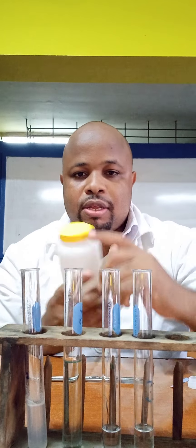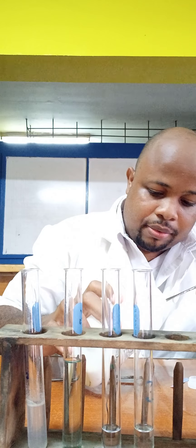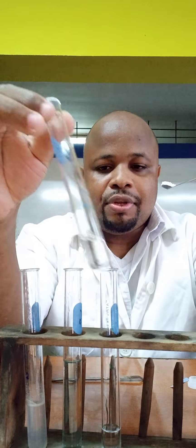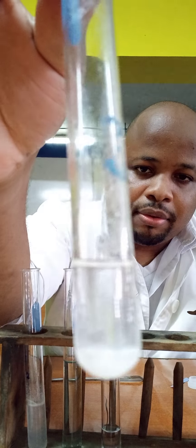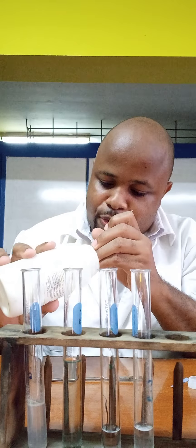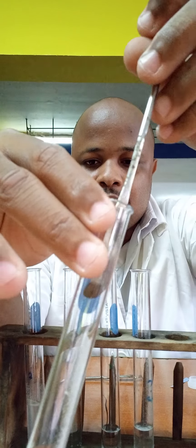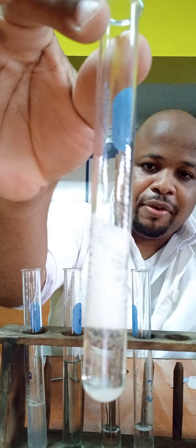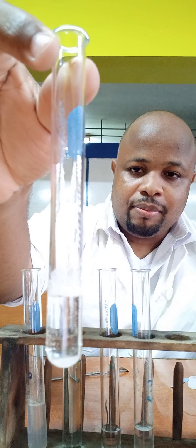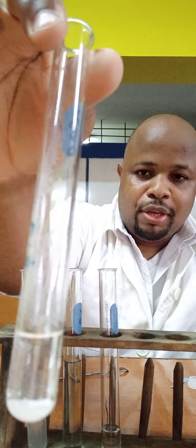The final reaction — I'm going to add a small amount of sodium carbonate to each test tube. First to the test tube containing liquid A, then a small amount to the test tube containing liquid B. Clearly you can see the effervescence taking place. For liquid B, nothing is occurring.